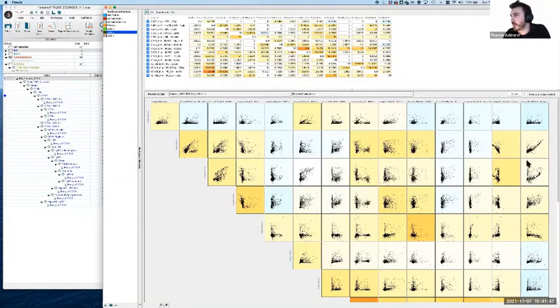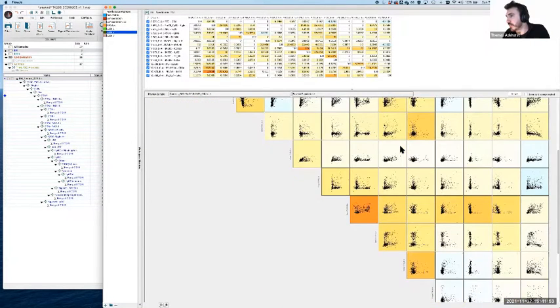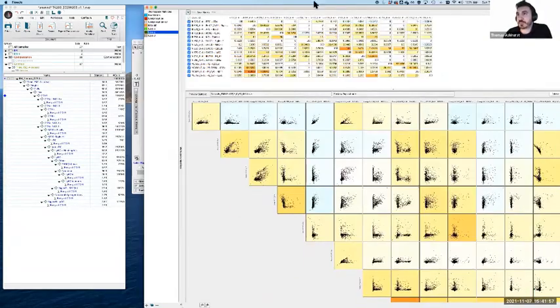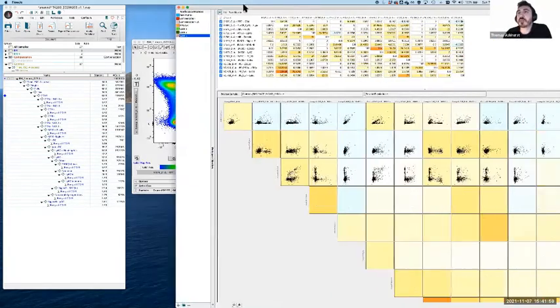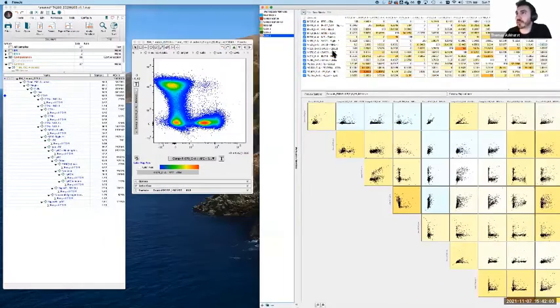We just fixed it up, so probably this won't be as obvious as it should be, but nonetheless, very helpful, I think. So very good point, thank you. And actually this particular issue, which is in case 3, well, this one will show up, but it won't be quite as obvious.